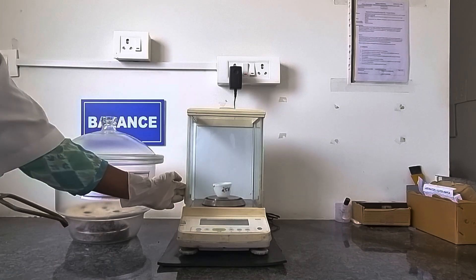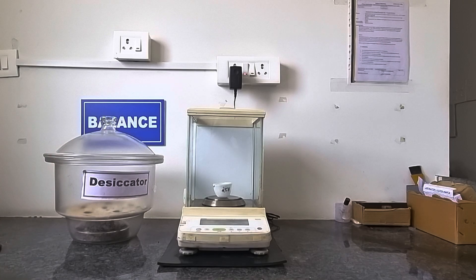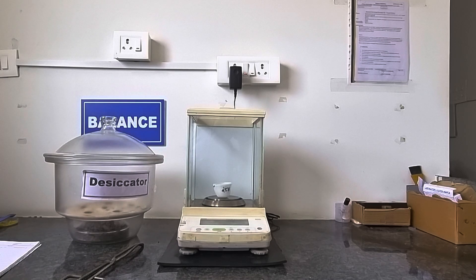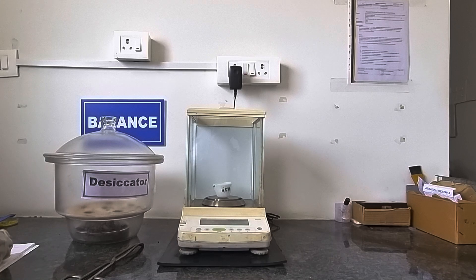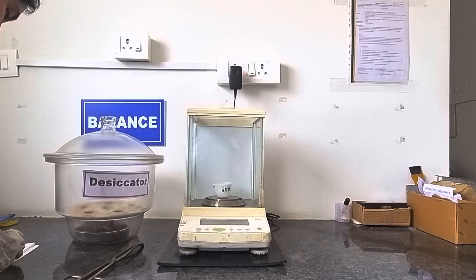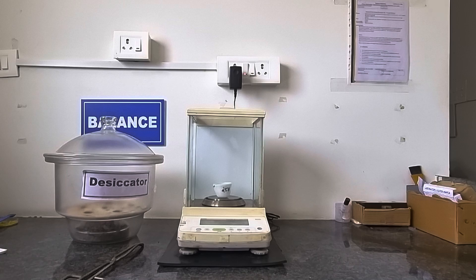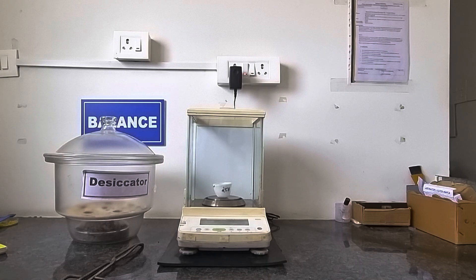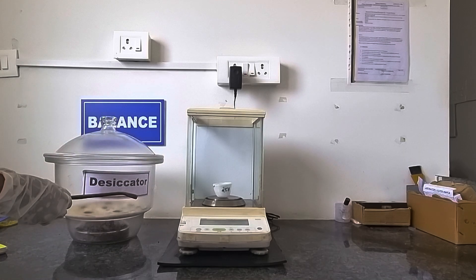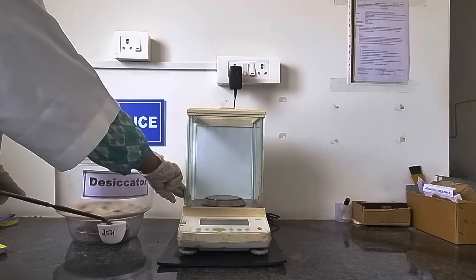Keep it on the balance and record its final weight — whatever weight we will get, that will be the weight of your ash along with the crucible. In practice, we have to take consecutive readings for constant mass. That means we actually follow the procedure of weighing and keeping in the furnace for at least 2 to 3 times until we get a constant mass. This is all about the procedure of total ash content.